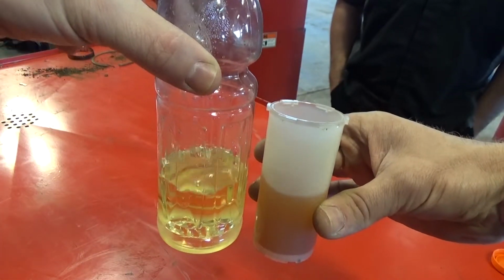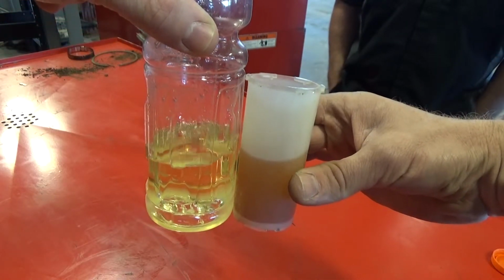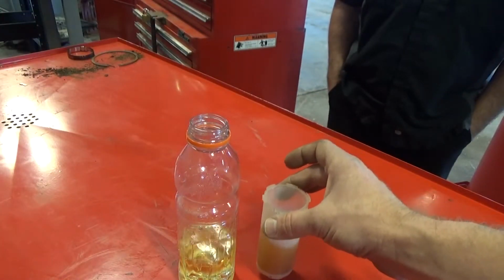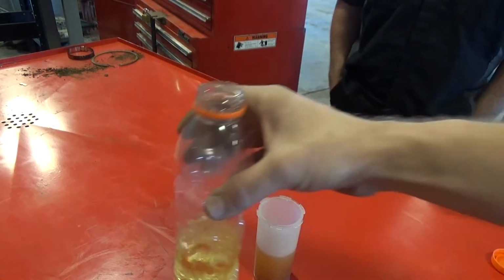I know the one is in an opaque color versus a clear, but you can definitely see this one is much darker and kind of nastier. And the smell is really distinct. If you smell this, it almost smells like turpentine, kind of nasty, stinky, versus a normal gasoline smell.